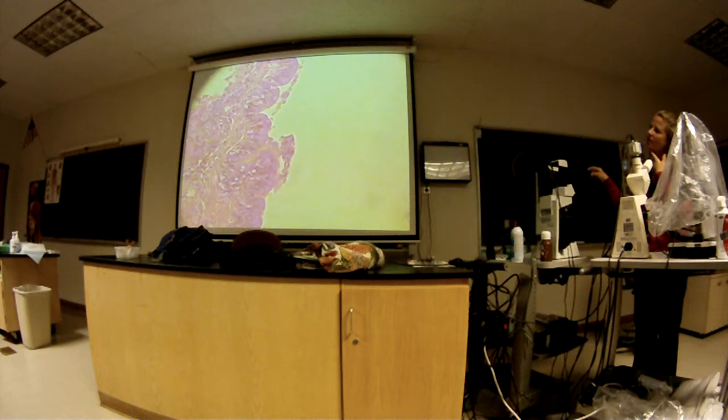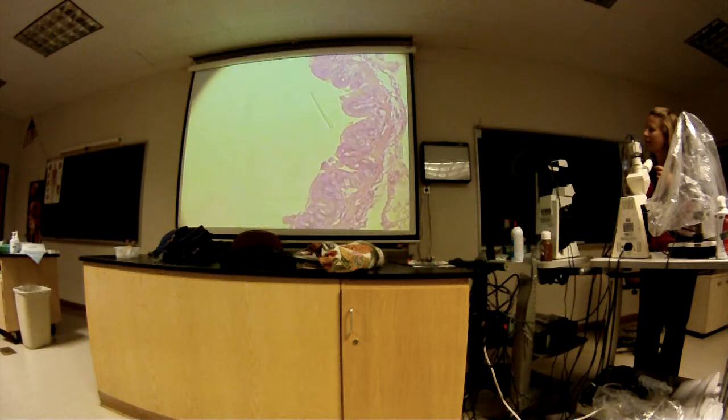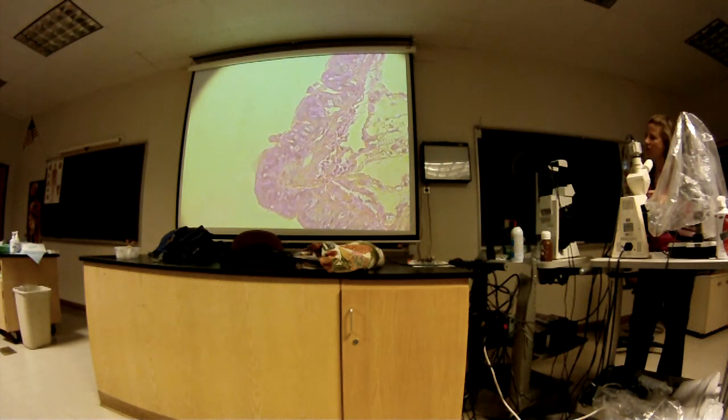It's probably got a lot of replacement cells, new stem cells coming from behind, so it looks multi-layered, but I see a little one right there that looks pretty good. And here's the smooth muscle. This is a bronchiole, and so it can have this wavy appearance, depending on whether it's expanded or more retracted. It can look more without the waviness as well. So here's the smooth muscle back here. So this is the bronchiole. These are the smallest passageways.